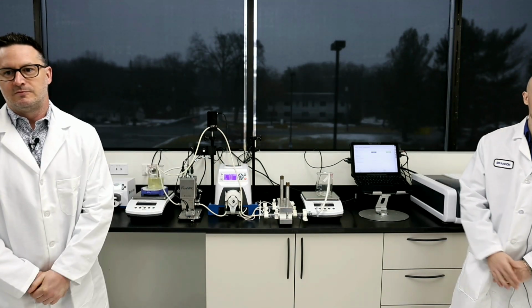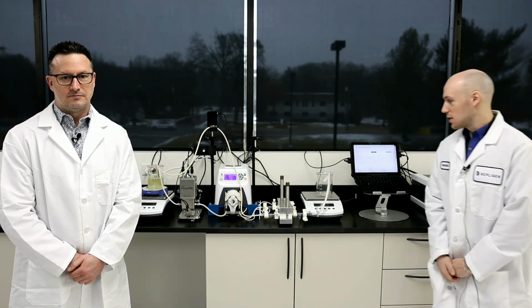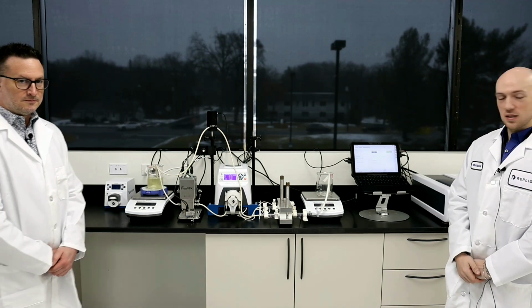Perfect. Hi, everyone. I am the Senior Field Application Scientist for the Mid-Atlantic Territory, so my partner is James. And basically today we're going to go over the KR2i RPM system like you mentioned.